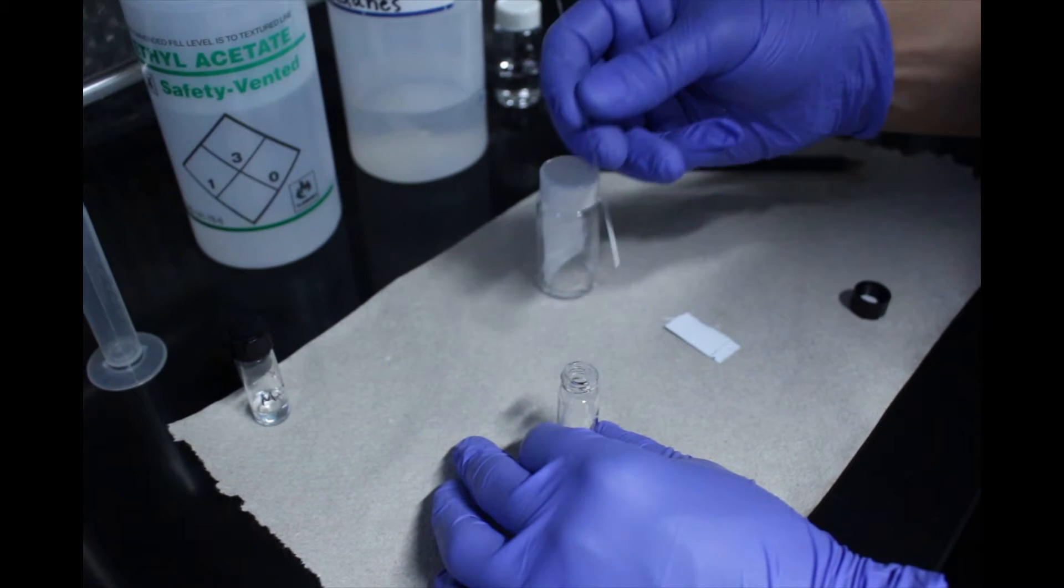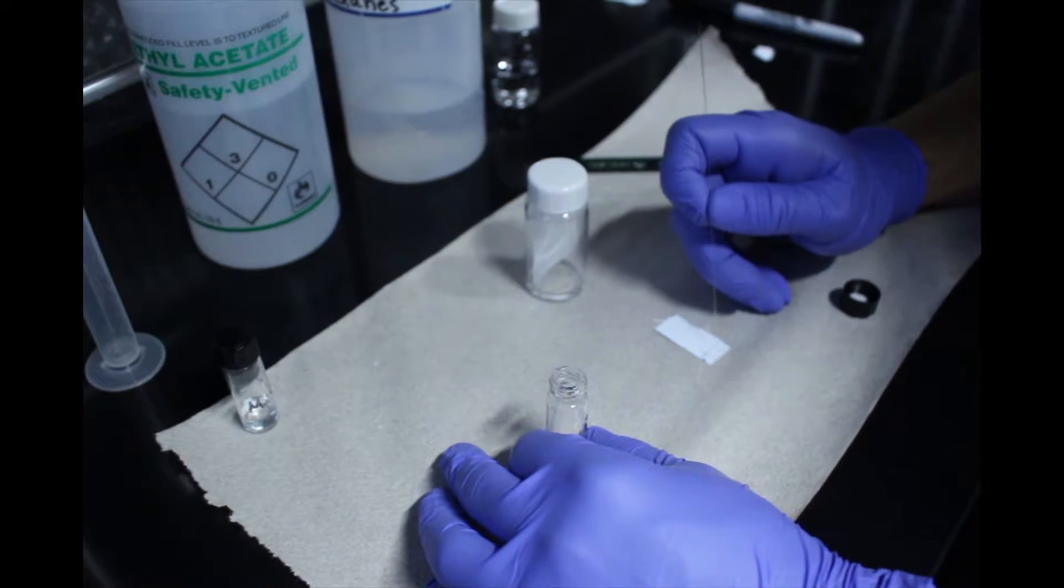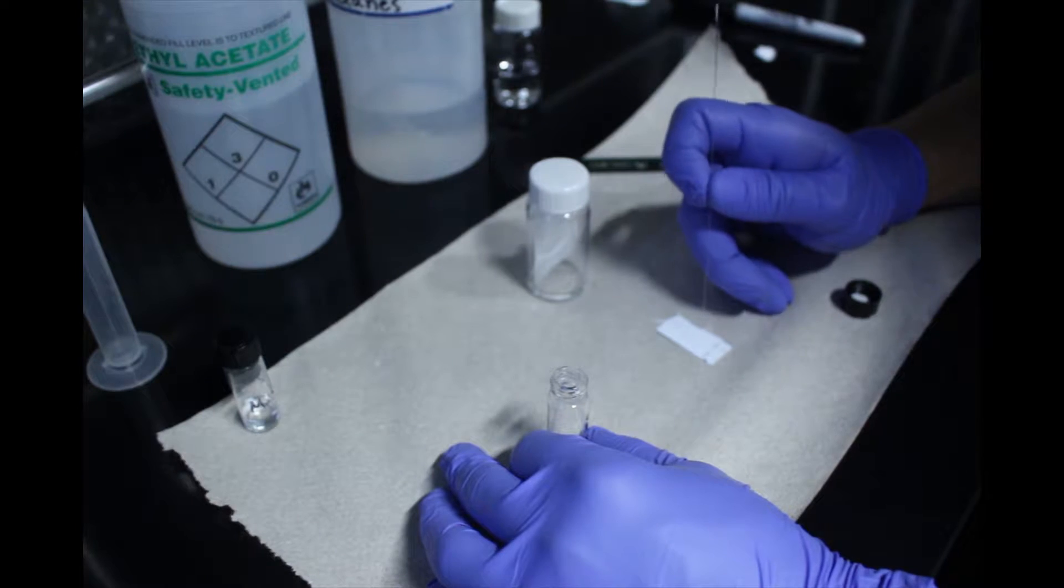Using a glass capillary tube, spot a diluted sample on each line. Two-lane TLC is performed for consistency.